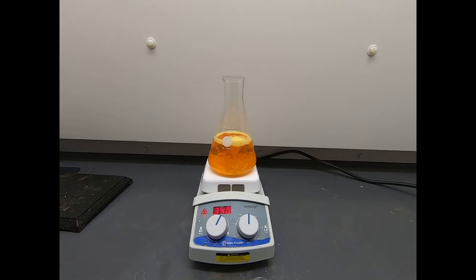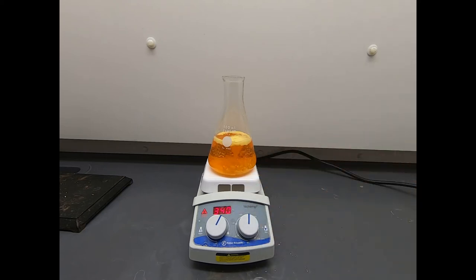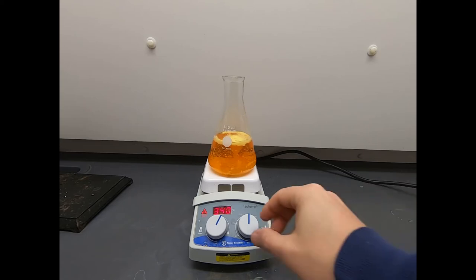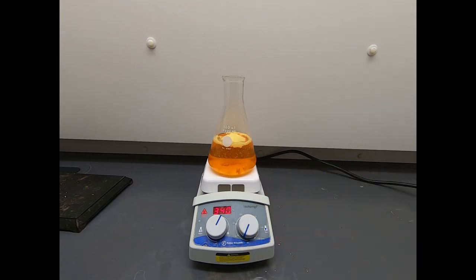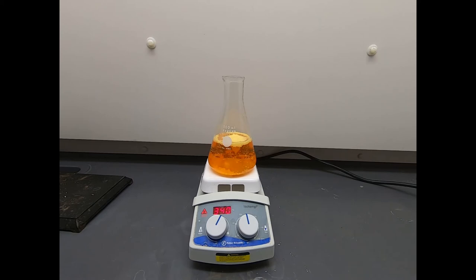Okay, so this clearly hasn't dissolved, but I want to come in and bring up a couple points. One, because I'm impatient, I turn up the heat. This now says 340 degrees Celsius, and I turn up the stirrer because I'm impatient and I want this to go quickly. But one thing I'll note is that when you stop this stirrer from going, you see that there's still clearly solid that hasn't dissolved, but that amount of solid is less than what I put in. So when you're dissolving things in a reaction, it's important to kind of take a mental note. How much solid is still left? Is that amount of solid getting smaller? Is it staying the same? These are just part of the observational process because if I felt like this wasn't dissolving, then I might be encouraged to heat it up even faster. So making good observations helps drive your decisions on how you're going to move forward, and that's true for this type of recrystallization or whether you're working with a new unknown solid.